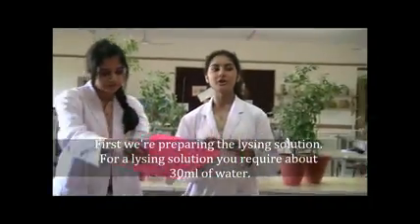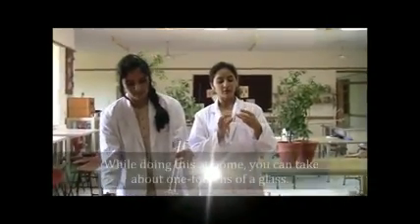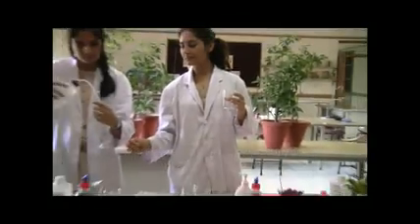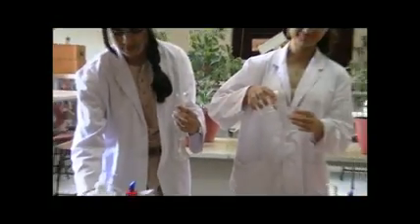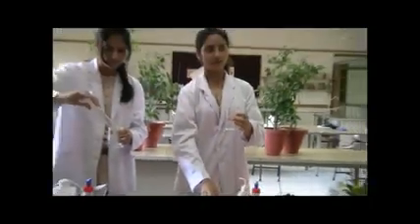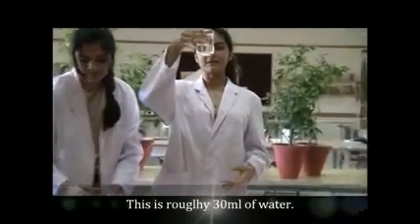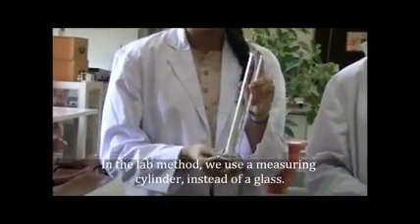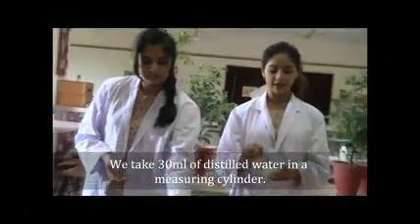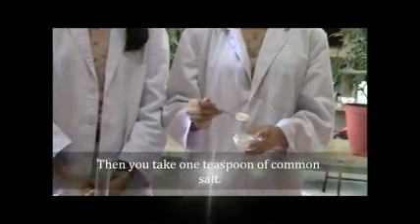First, we are preparing the lysis solution. For a lysis solution, we require about 30 ml of water. While doing this at home, you can take about 1/4 of a glass. This is roughly 30 ml of water. In our lab method, we use a measuring cylinder instead of a glass. We take 30 ml of distilled water in a measuring cylinder. Then you take 1 teaspoon of common salt.